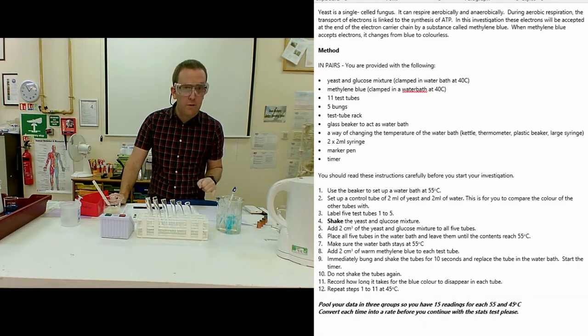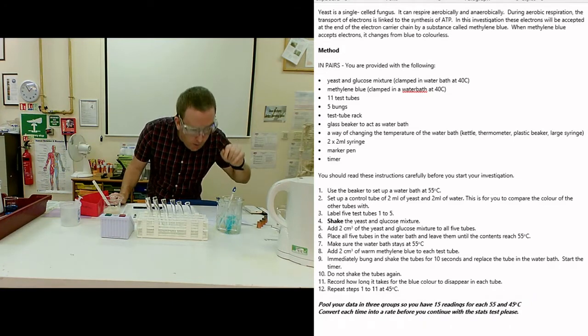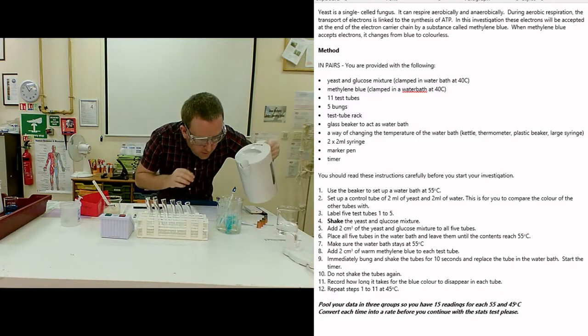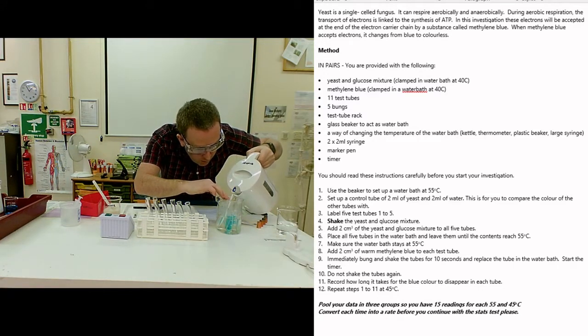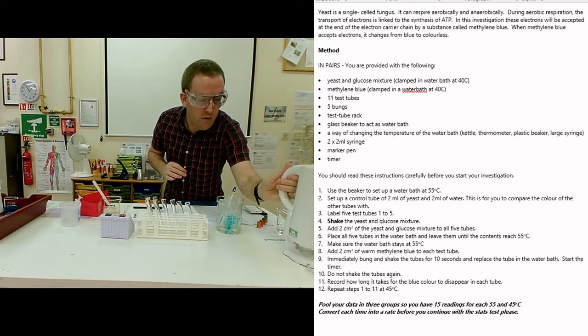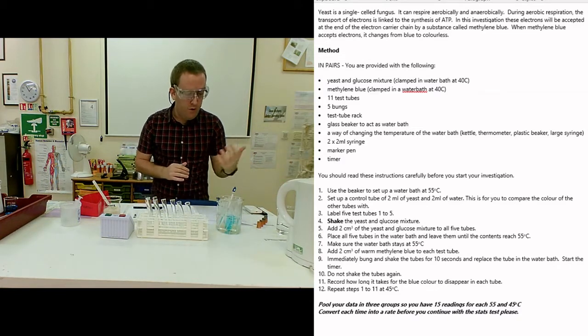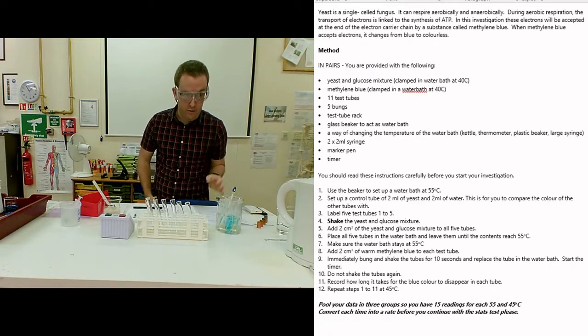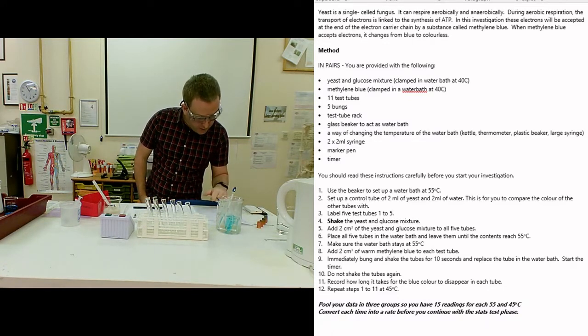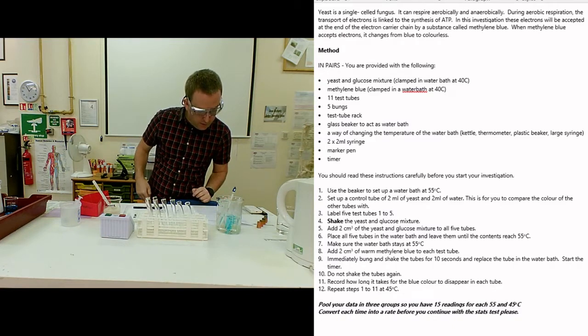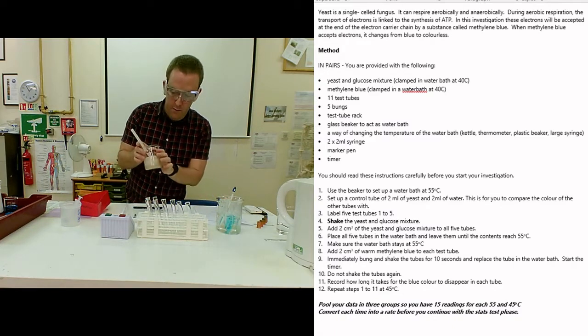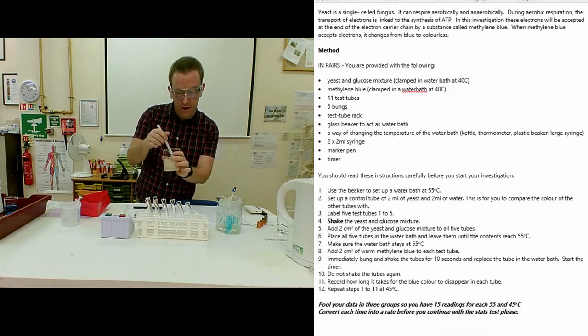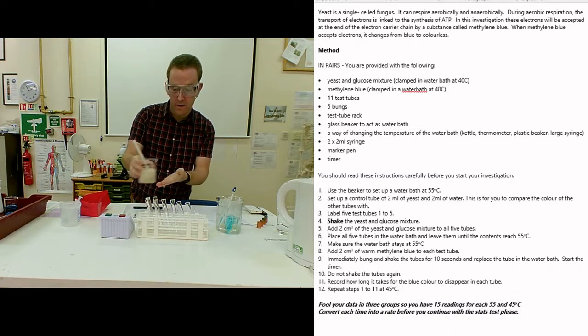I'm doing 45 degrees C and my water bath is going a little bit cool, so I'm going to add a bit more hot water. I'll do that periodically to bring the temperature back up to 45. Yes, that is raising the temperature very nicely. First thing I need to do is shake the yeast and glucose mixture well. As you can see, that is highly active, highly oxygenated, highly aerated yeast, so that is ready to go.